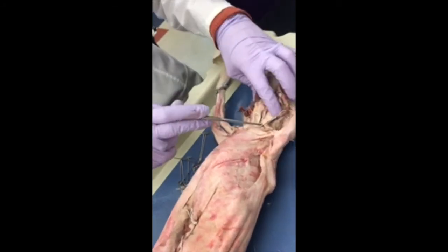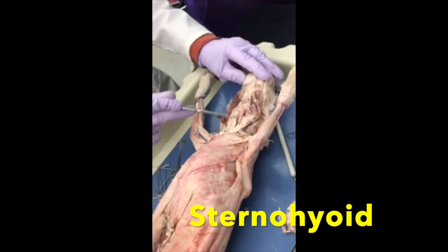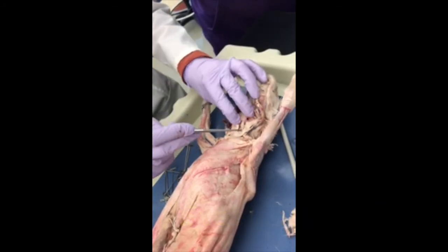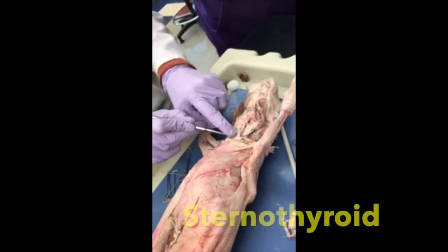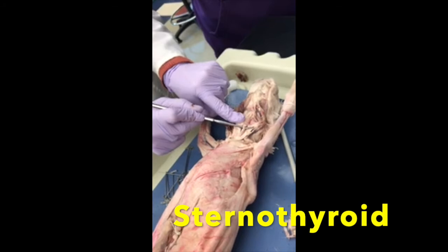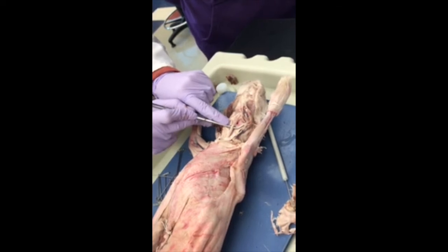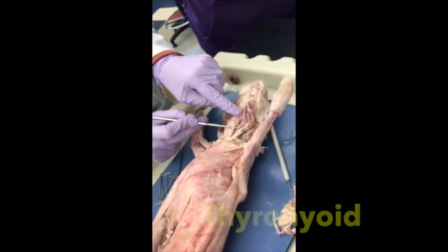So those are good. The muscle on your trachea is the Sternohyoid. The whole thing. It's all the way up to the hyoid. Sternohyoid. On the side is the Sternothyroid. Because right there on the larynx, my voice box is right there, is the thyroid cartilage. So it originates on the sternum, but stops on the thyroid. Whereas my Sternohyoid went all the way up to the hyoid.